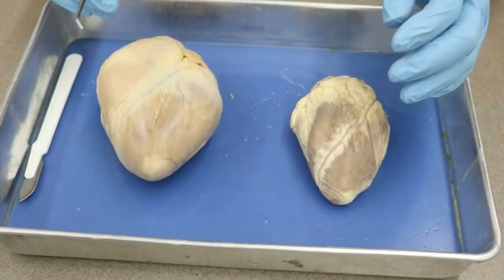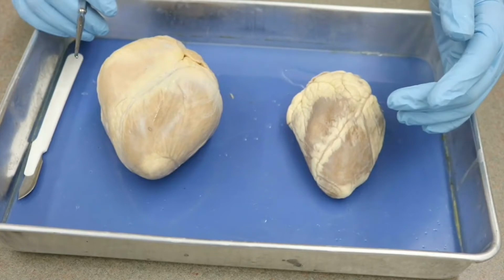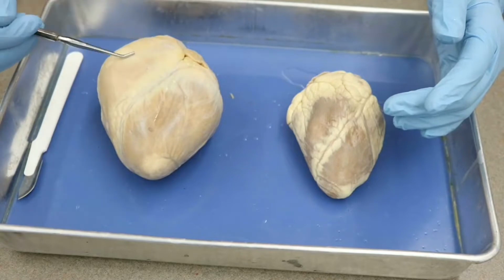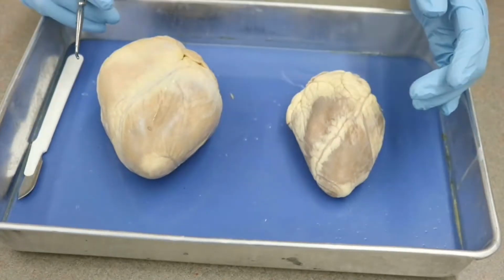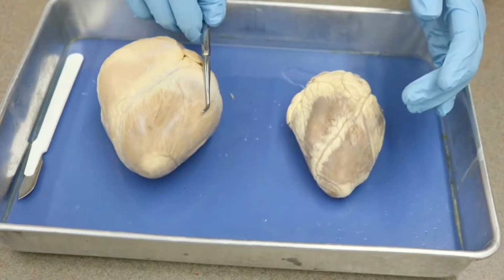With that understanding, we're going to need to look at where our chambers of the heart are. The ventricles are closer to the apex on the inferior aspect, while the atria are closer to the base at the superior aspect. Now, as always, you are looking at these as if they are your patient. So this is the patient's right, and this is the patient's left.